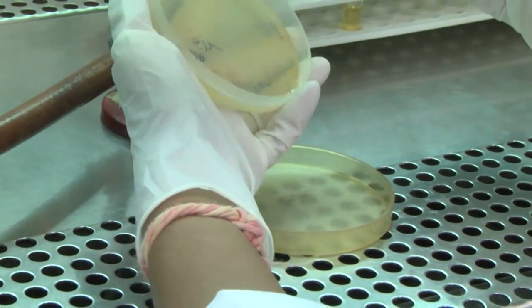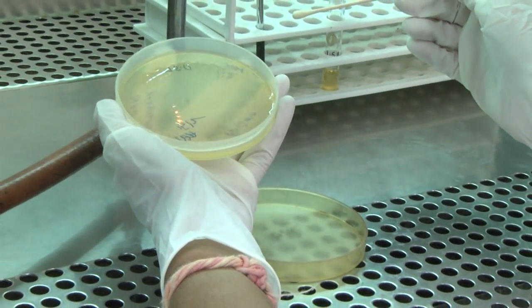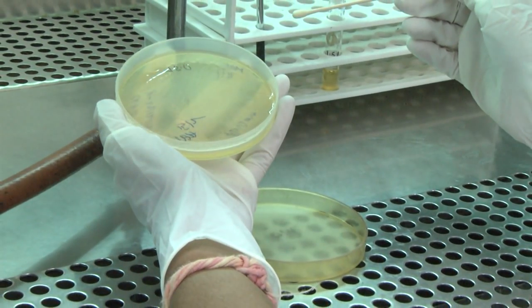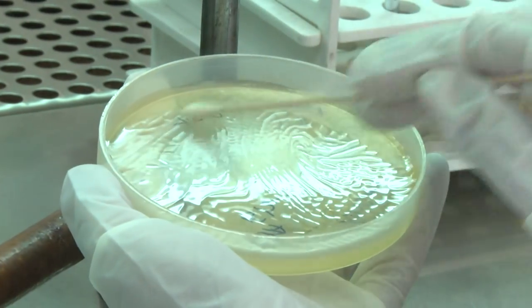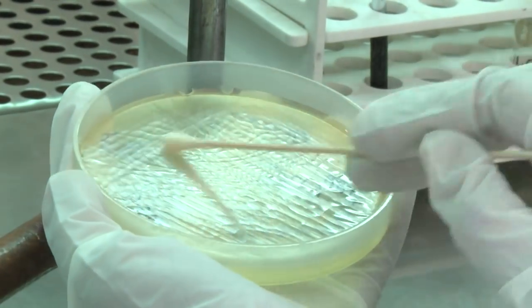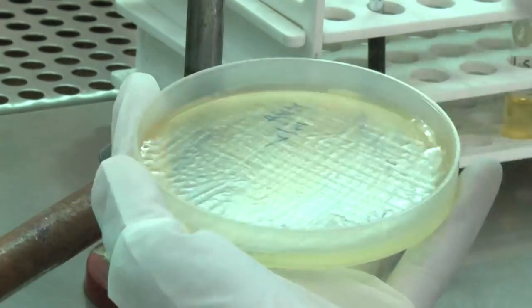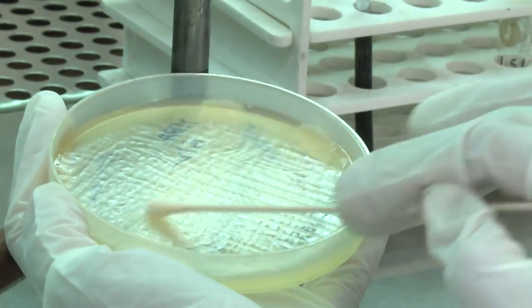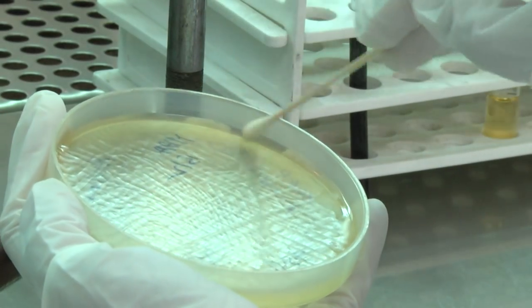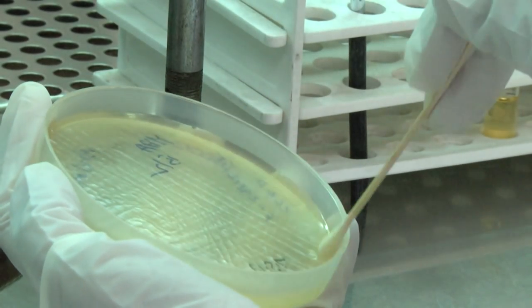Lift the base of the plate containing the medium in your left hand and hold it using your thumb and middle finger. Streak the swab all over the surface of the medium three times, rotating the plate through 60 degrees after each application. When the whole plate is covered with the inoculum, pass the swab around the edge of the medium.